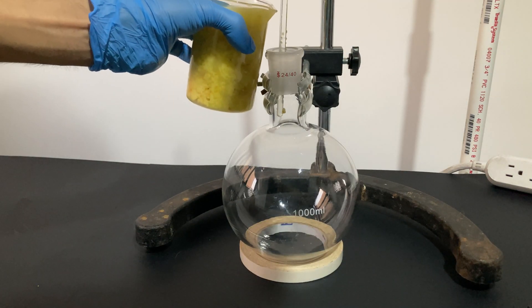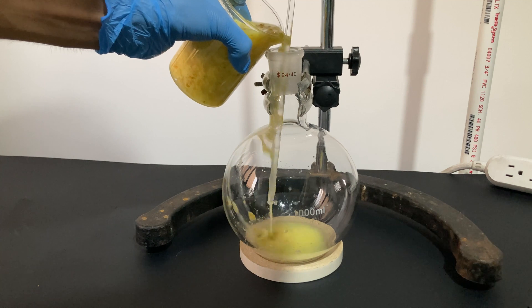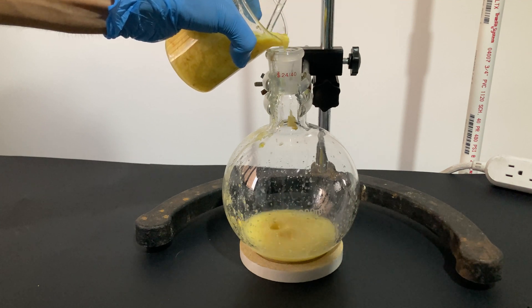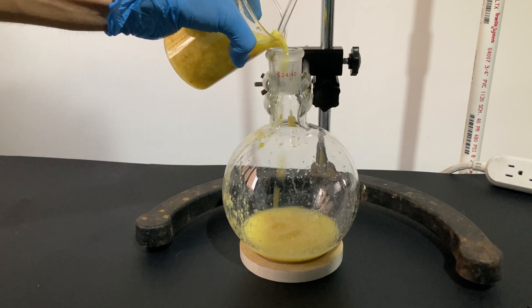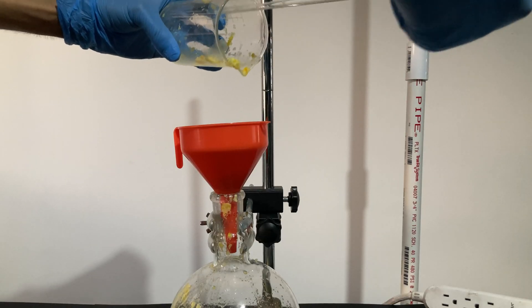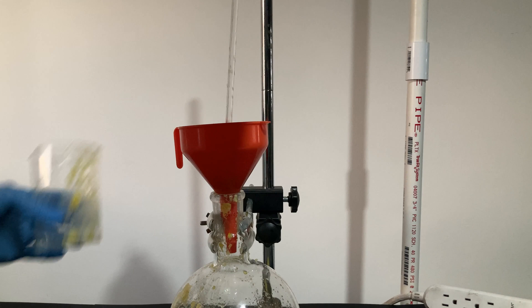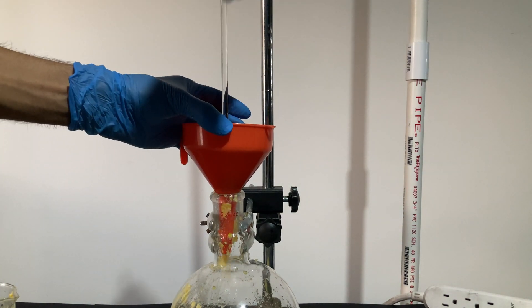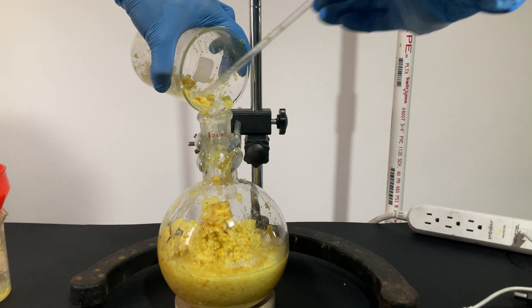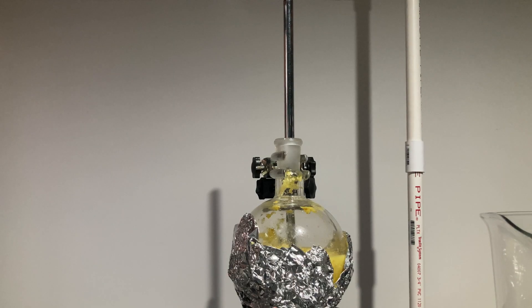Then I transferred the mixture to the boiling flask — I swear this should be easier, but somehow I managed to complicate it. If you're watching this and thinking that I'm not doing it fast enough, you're right. I'm not doing it fast enough. I even tried with a funnel, but it was way worse, as the mixture got stuck and I had to force it out. After minutes of suffering, I went back to the original plan and used up the little patience I have.